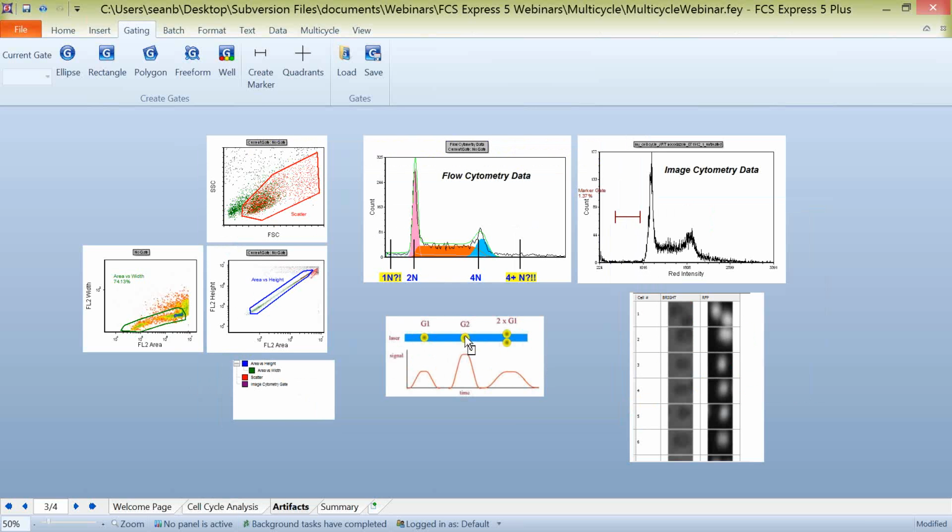So if 2 G2 cells stick together, this may look like an 8n population. Or if 2 G1 cells stick together, this may look like a 4n population. Or if a G1 and a G2 cell stick together, they're going to fall somewhere between as an S phase population. There are many combinations that can occur from cells sticking together, but generally these are referred to as doublets. In most cell cycle analysis experiments, you should be collecting width, area, and height parameters, which will help you tease out single cells from doublets.